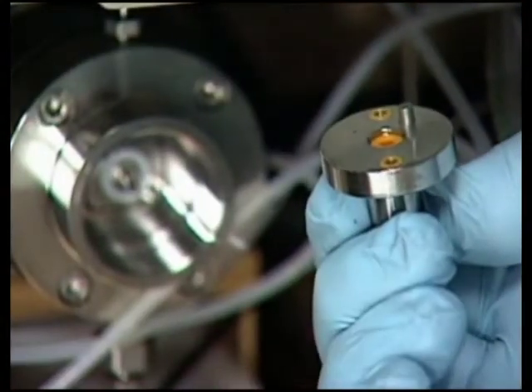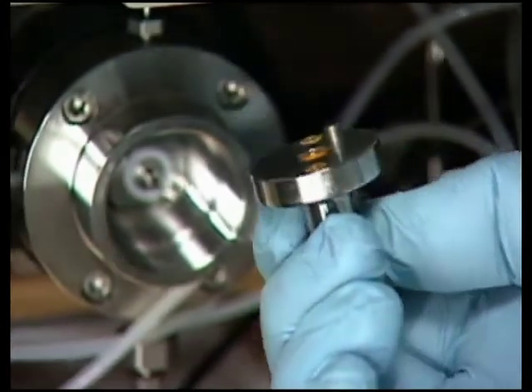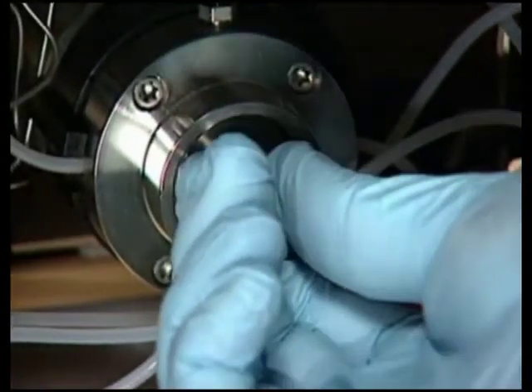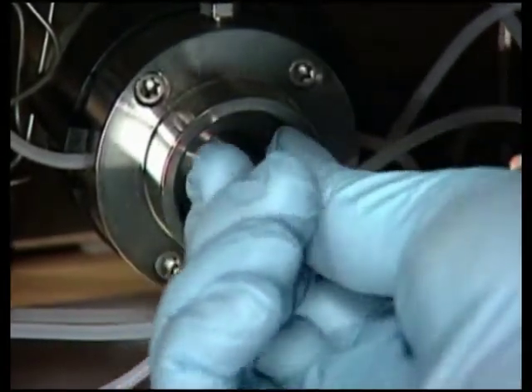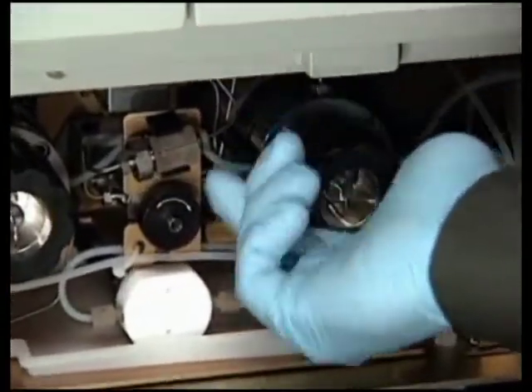Once the seals have been replaced, insert the head assembly into the piston cavity, making sure the head alignment pin is properly oriented and the J-tube is facing down. Replace the head nut and turn it clockwise until the head nut is tight.